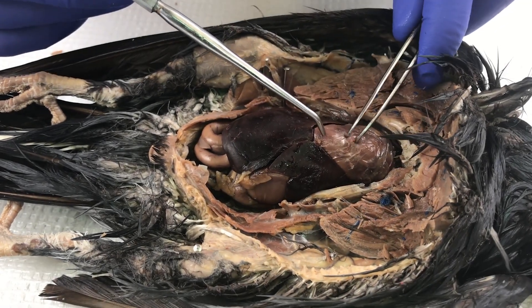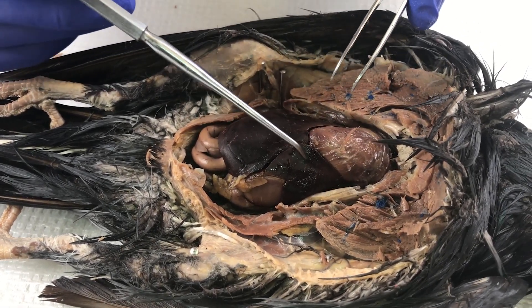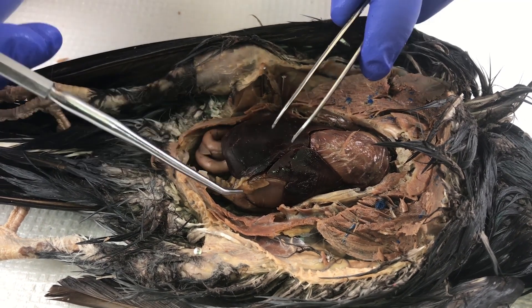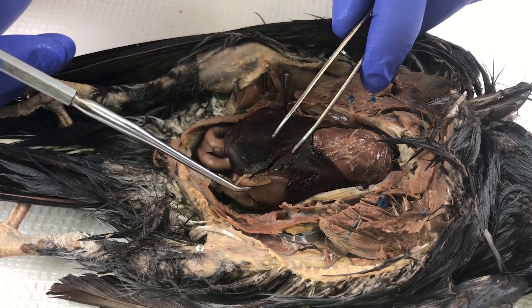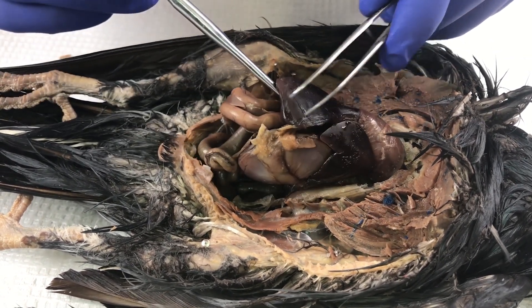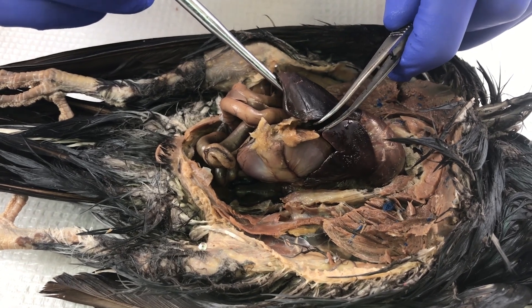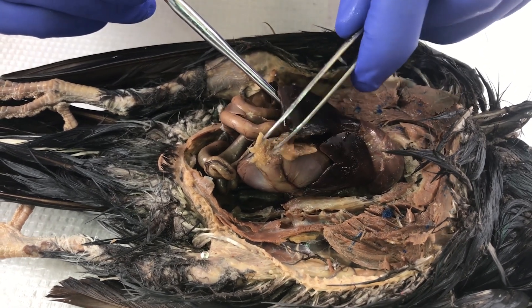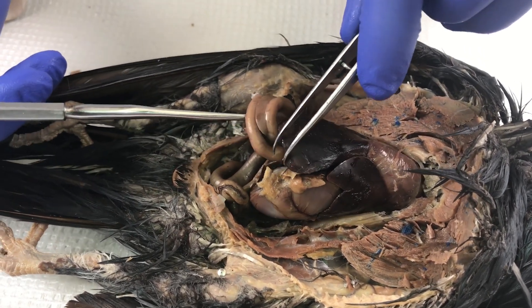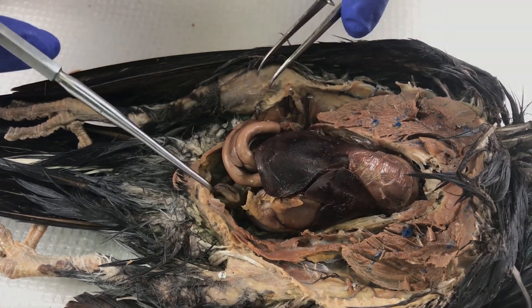In another view, you can see the heart — the pericardium is very clear in this one — the liver lobes, and the gizzard is very nicely seen from this angle. Again, the small intestines and the pancreas are very visible as well.